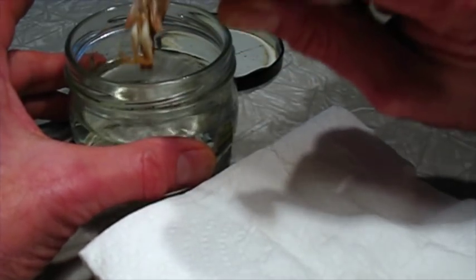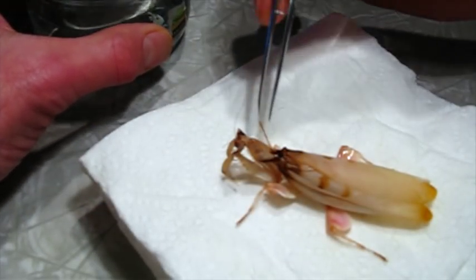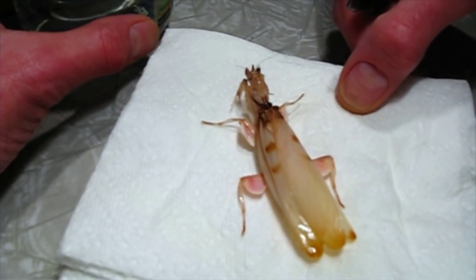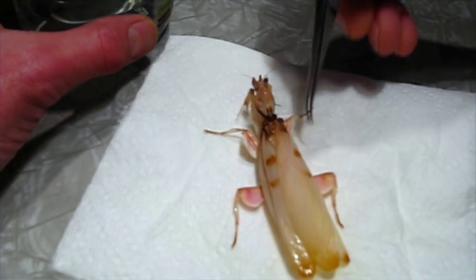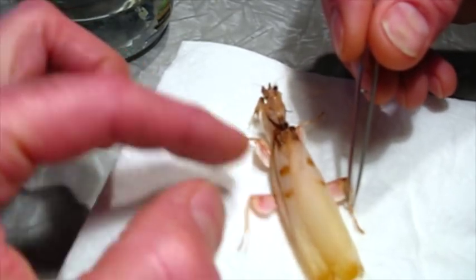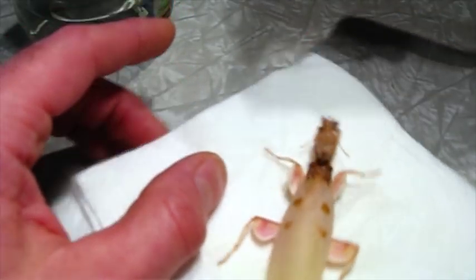It's a beautiful specimen. I'm soaking this in acetone — acetone is toxic and flammable, so you should always be careful with it. Normally we're careful about soaking green katydids, phasmids, stick bugs, or leaf bugs because the acetone can bleach out the green and turn it kind of yellow. I was concerned about this as well, since I've never prepared one of these before. Usually I only soak it for a few hours, but yesterday I soaked it for around five or six hours and it was still kind of soft. I think this mantis hadn't entirely hardened its exoskeleton in the short time it was an adult, so I left it in overnight. It's stiffened up well, there's still pink in it, and we want to preserve the lovely white color. If you just dried this out without an acetone soak it would turn brown. So I think this is actually going to turn out really well.